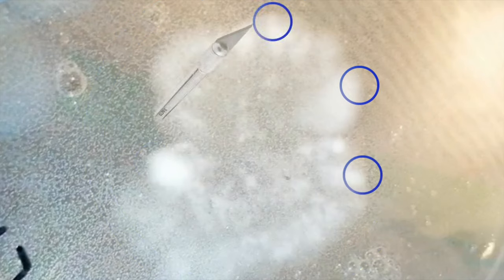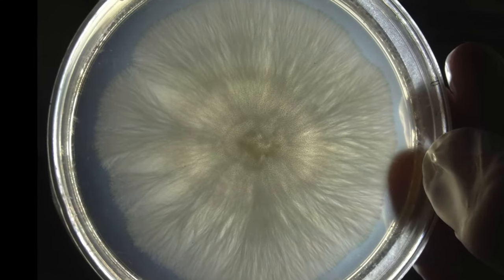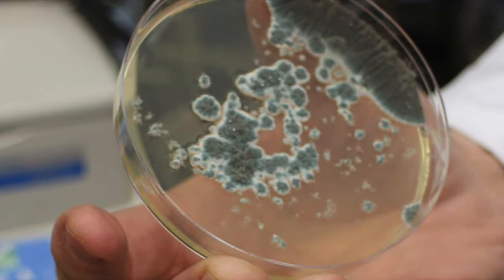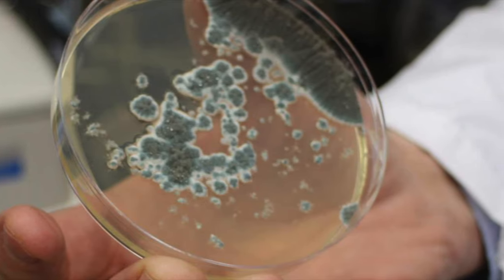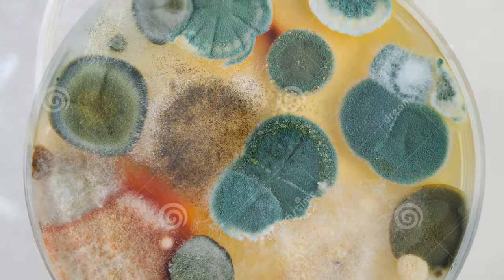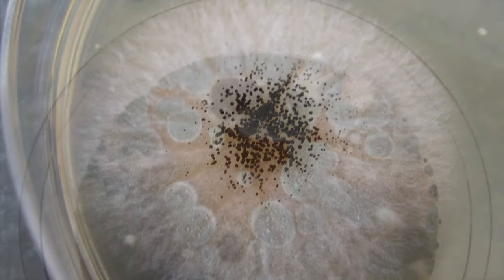In my opinion it's better to just make spore prints from your best specimens — mushrooms you grow from those prints will be very similar to the parent they came from. Spores are the ultimate long-term storage solution because they can remain viable for years, even a decade, at room temperature, and they take up almost no space. Getting back to where you should take cuts from a plate: you might think the area showing the most vigorous thick growth is best, however notice if it is not moving as rapidly towards the edge of the plate as other areas of growth — it's probably not the best candidate. Different species are going to look differently growing on agar. Here are a few pictures of contamination — anything that is a color other than white is contamination. Some molds will start off white then change colors as they mature. I would recommend disposing of any contaminated dishes immediately.